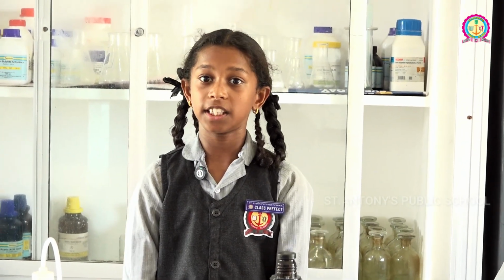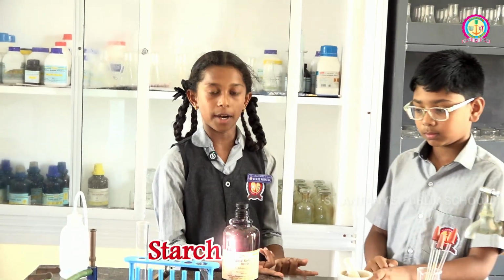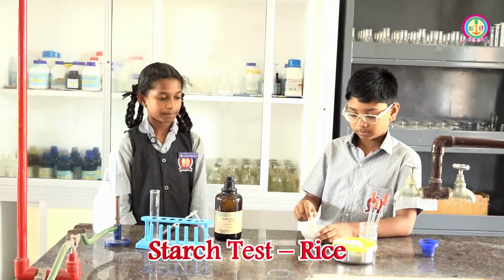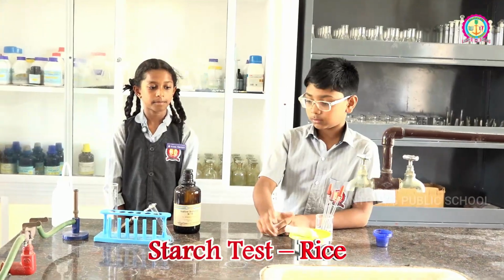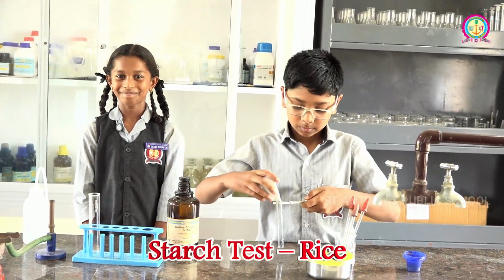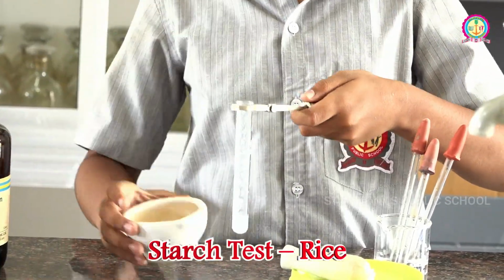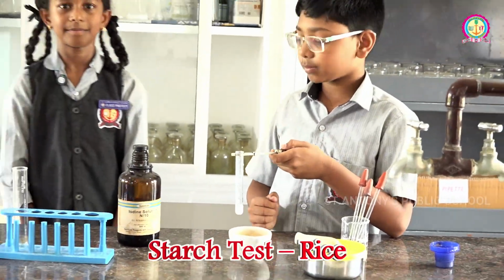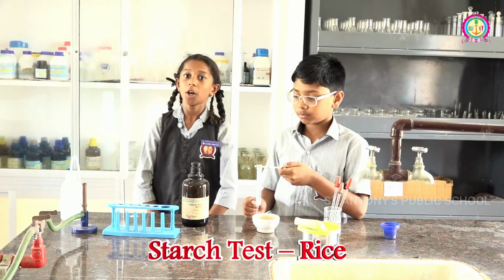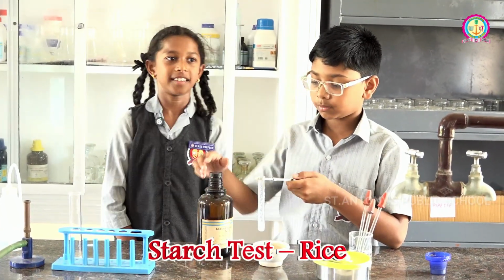Good morning everyone. Today we are going to test for starch in food using iodine solution. This is the food particle, rice. Then we add some 2 to 3 drops of iodine solution.